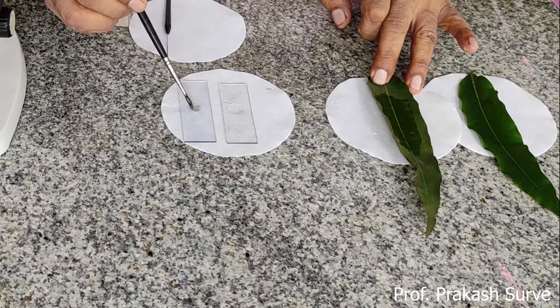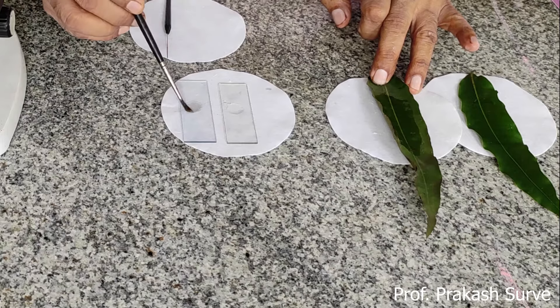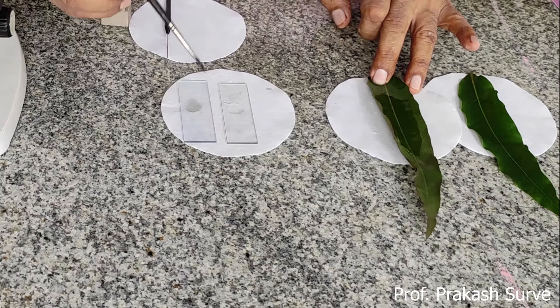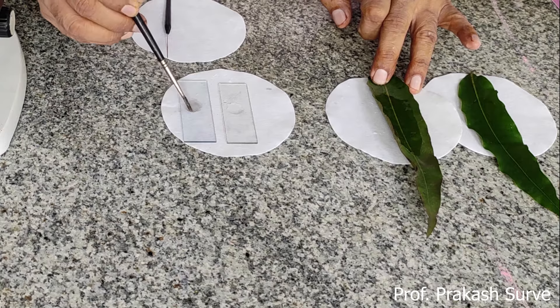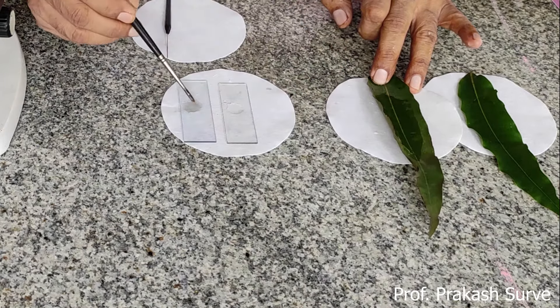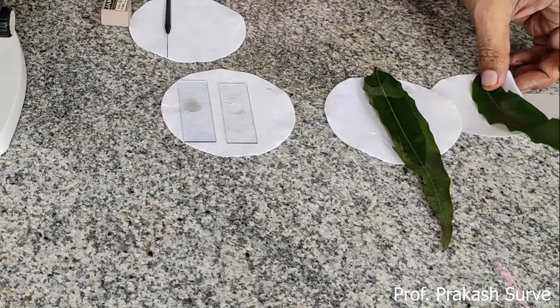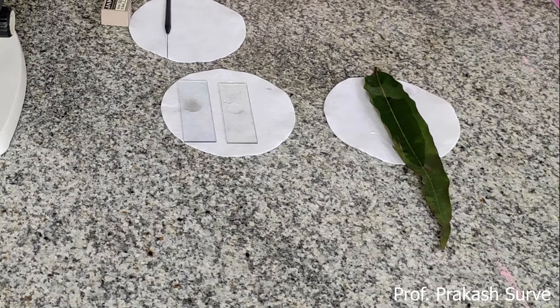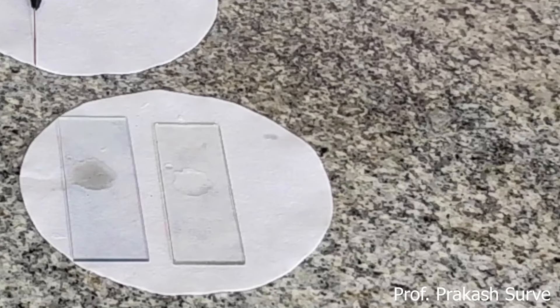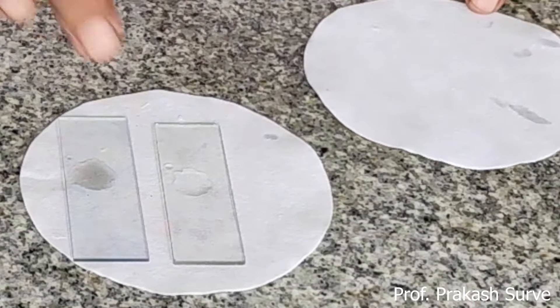We can already see the difference between the two slides with the naked eye. The slide from the washed leaf has clear glycerin, while the slide from the unwashed leaf shows glycerin with a brownish color, indicating the dirt particles present on it. Now we will examine each slide under the compound microscope.